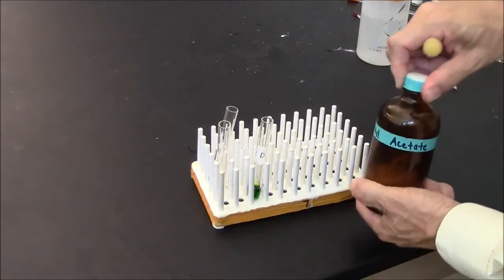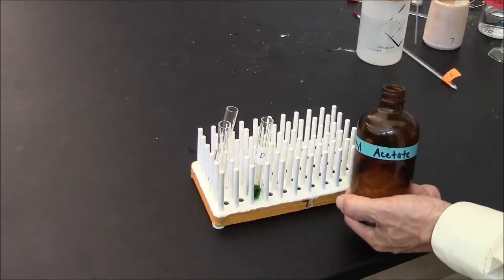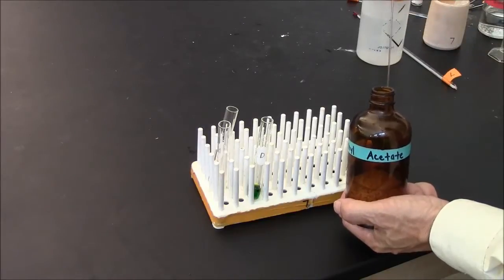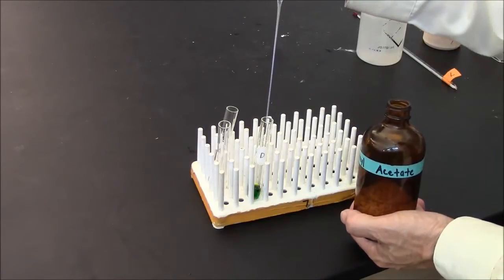I'm adding some ethyl acetate. In this case, I'll just use a pasteur pipette, but if I wanted a measured volume, I could easily do that. This is about 1 milliliter.